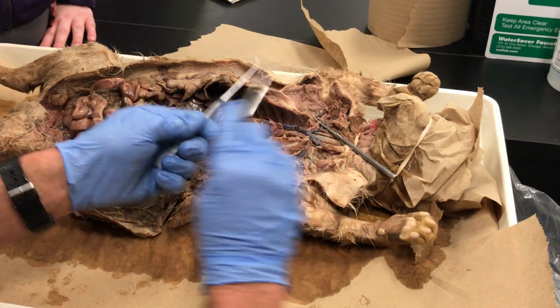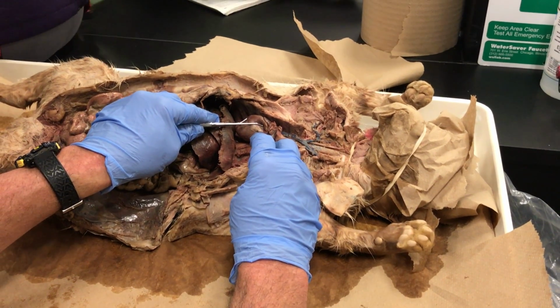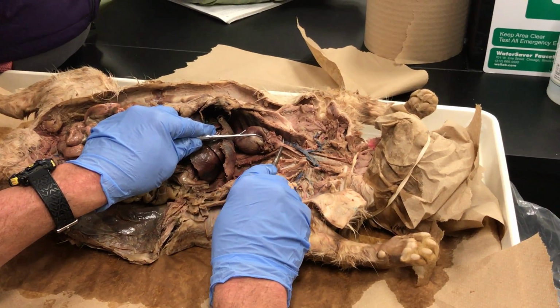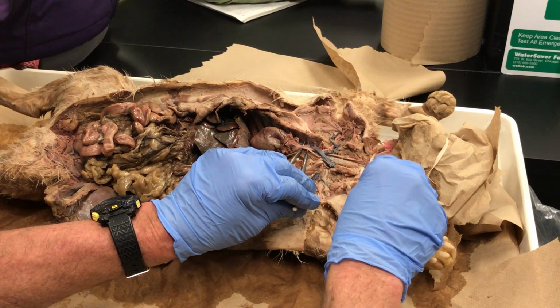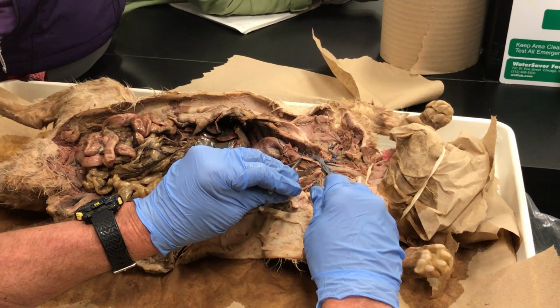So I'll point, you name. Okay, first big tube comes off the heart, only goes up a little bit and then hangs at 180 south. It's called the aorta. First major branch off the aorta? Brachiocephalic. And then, okay, first branch off the brachiocephalic up the left side of the windpipe is the common carotid, there and there.